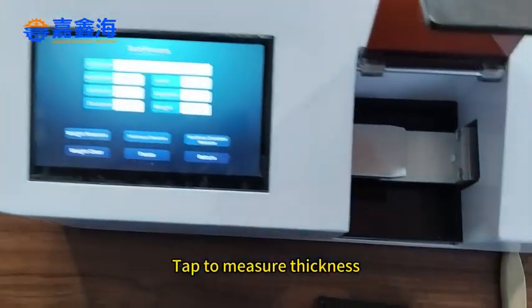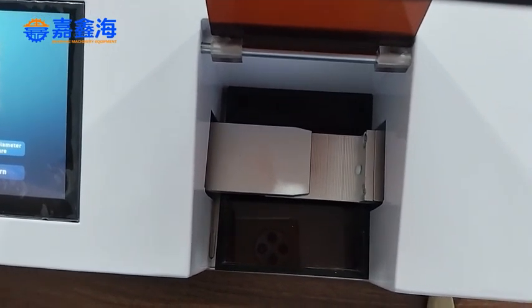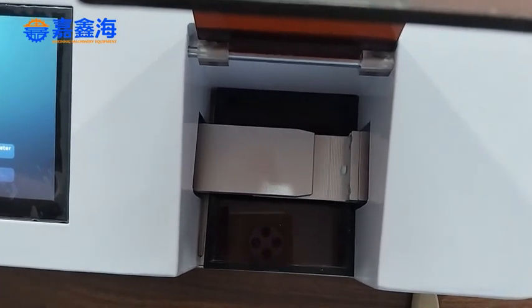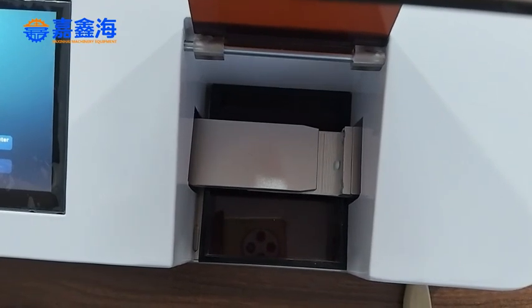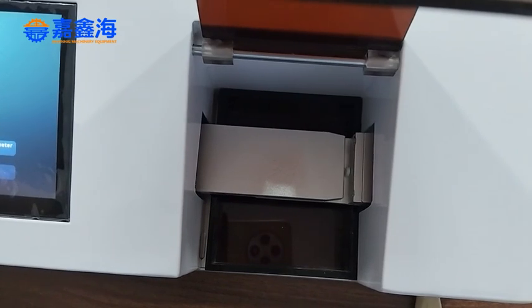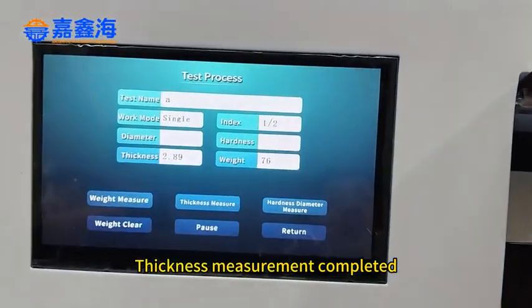Tap to measure thickness. Thickness measurement completed.